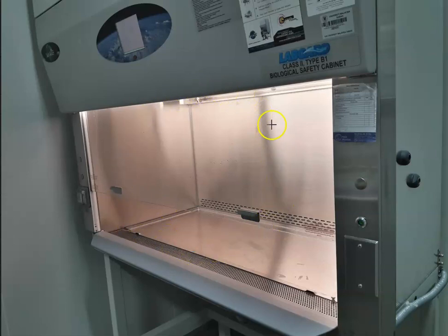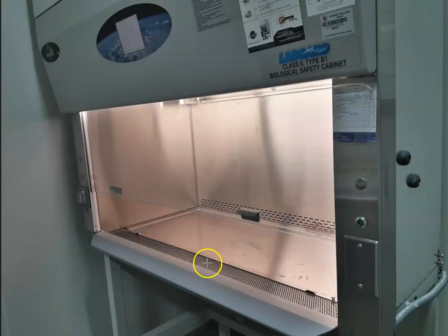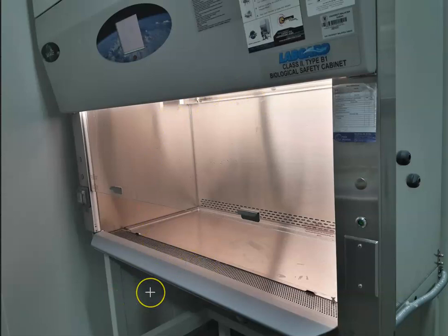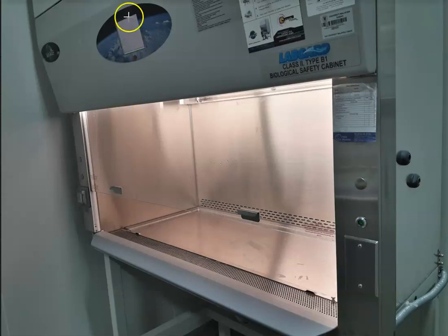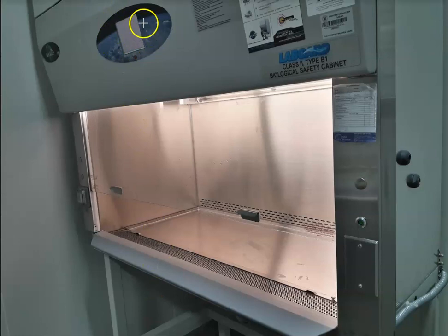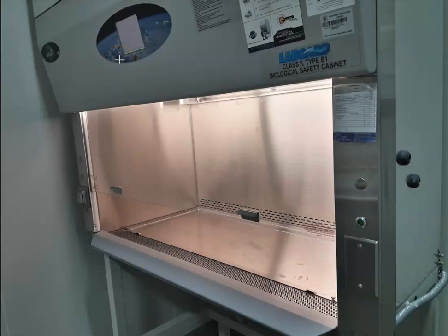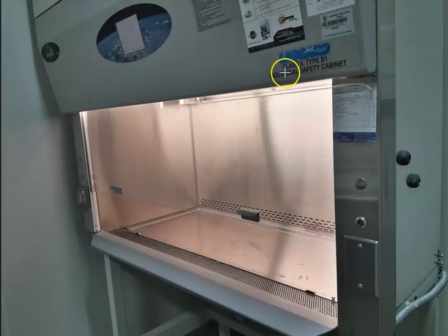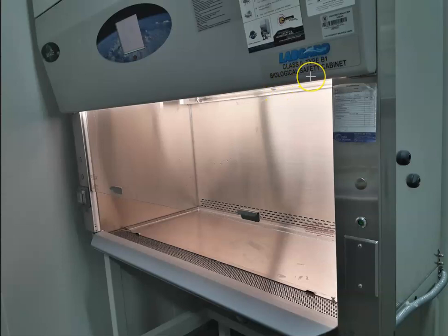This cyclical flow of air protects the operator or the laboratory user who will be sitting directly in front of this biological safety cabinet. If you look up at this region you will notice the controls and a digital interface. This cabinet is a Class 2 Type B1 biological safety cabinet.